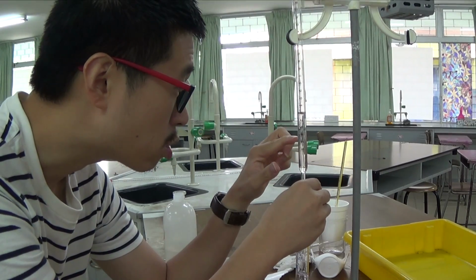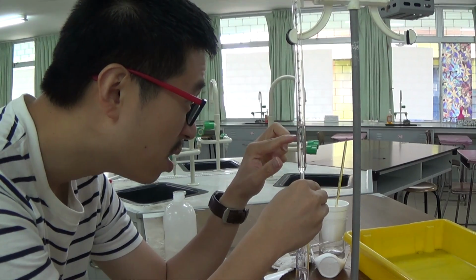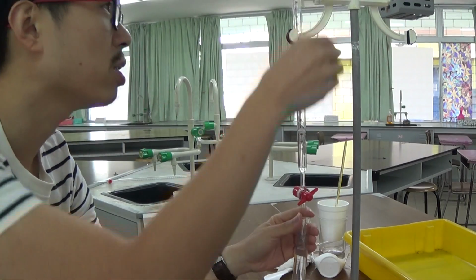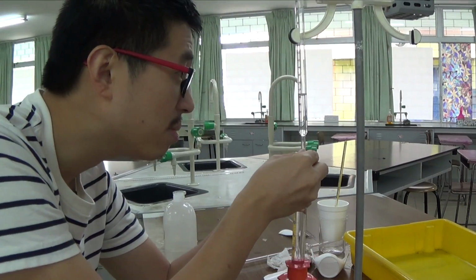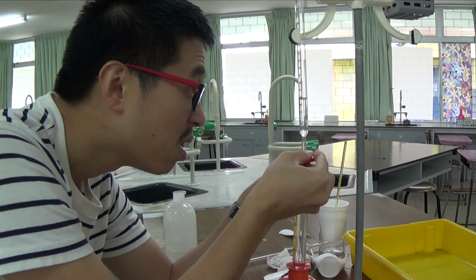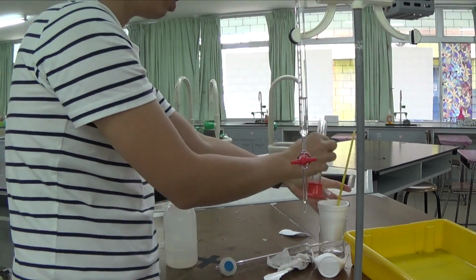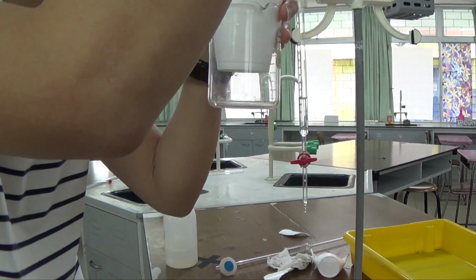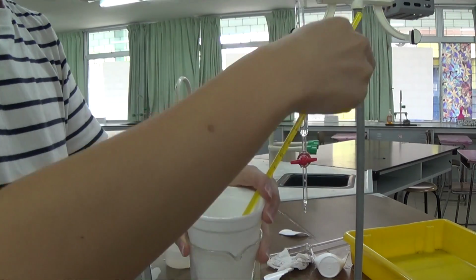So I started from 23. So 23.0 plus 25.0 is 48.0. So nearly there, nearly there. I don't want to read below the meniscus, so I'm just going to lift this up a little bit, so then I'm reading at eye level. So 48.0, and there's 25 cm cube. Oh, I forgot to read the initial temperature actually. Yep, it's still 22.0, pretty much the same as all the other experiments.